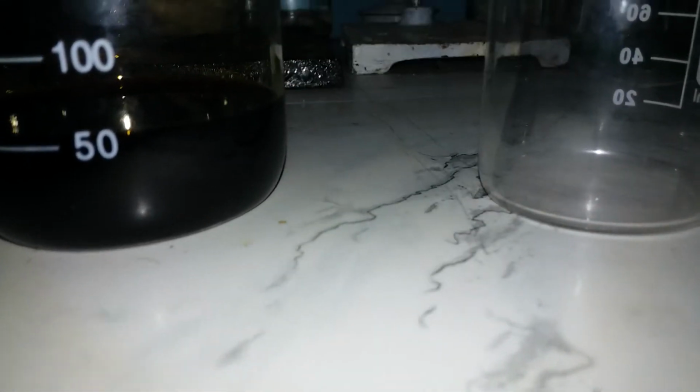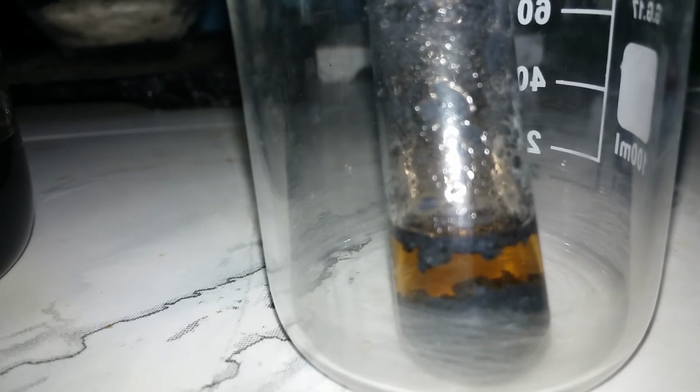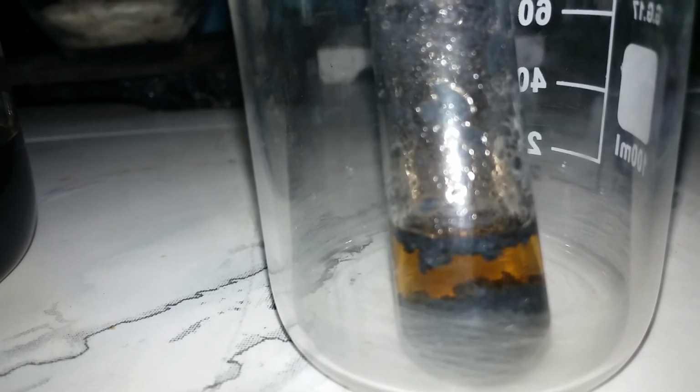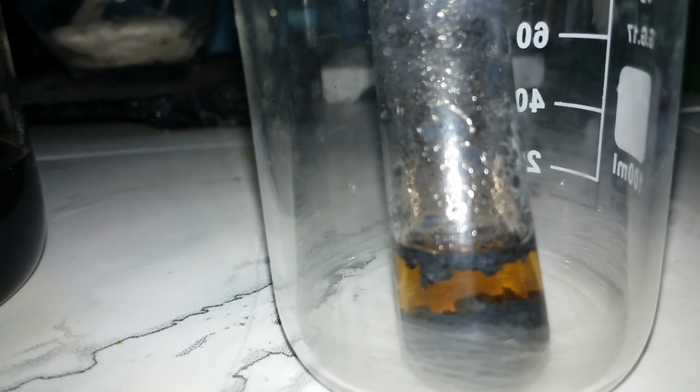Okay, so there's one thing to keep in mind, that nitric acid is a really strong oxidizer, and it might even oxidize the iodine to iodate. So you should keep it cold and filter out the iodine as fast as you can. So I'm gonna do that, and I'm gonna continue the whole thing in the second part. Bye.